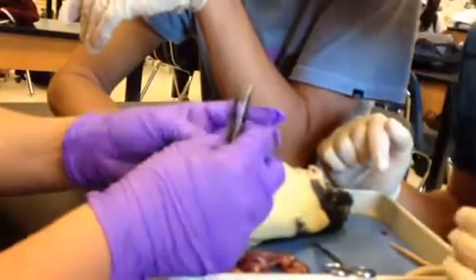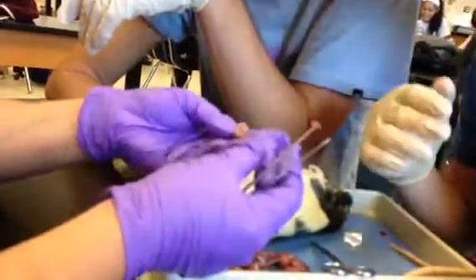Now, this is attached to it by the umbilical cord, and so you can kind of just pull it off. So we've got our first little baby.